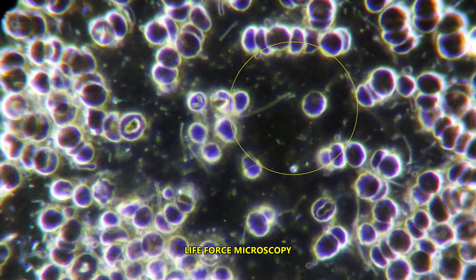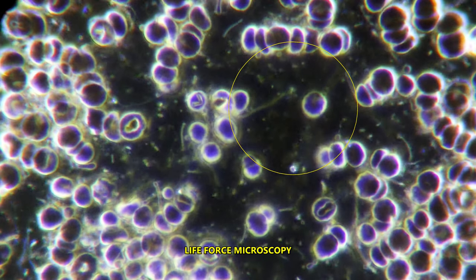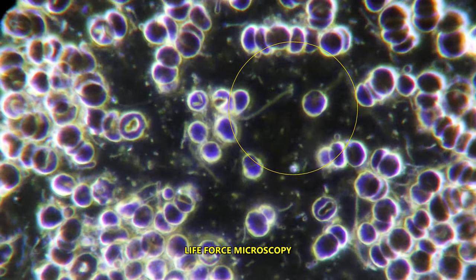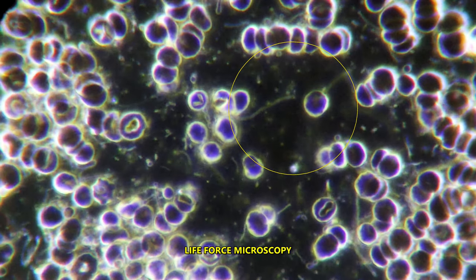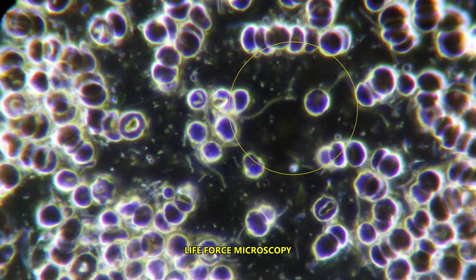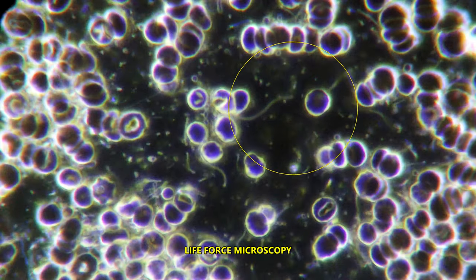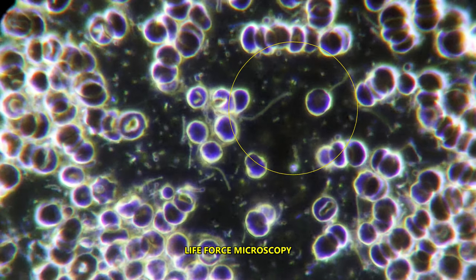This is not supposed to happen in a sample of fresh, just taken blood from a person.